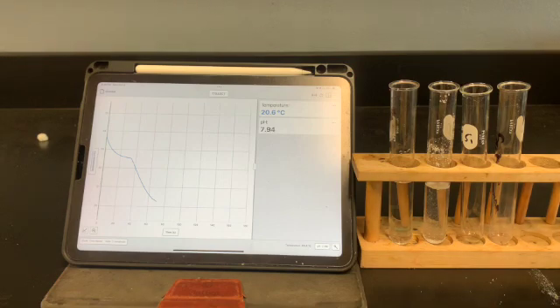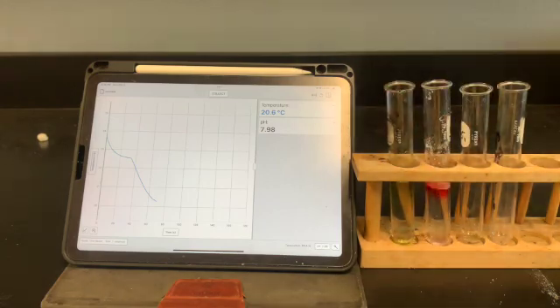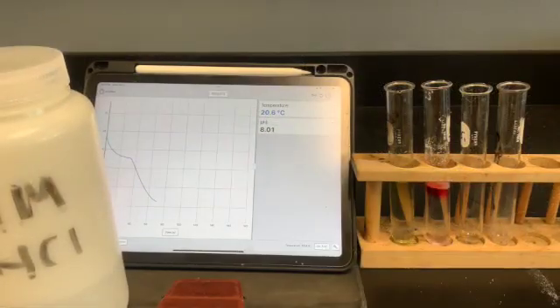Use your universal indicator, and we'll just get a reading. And that verifies what I was seeing with our pH probe. If you've already gone through the tests and you've already verified what it is, you don't necessarily need to do HCl and sodium hydroxide. It is just in case you still need to verify what you're working with. That's another way of doing it.